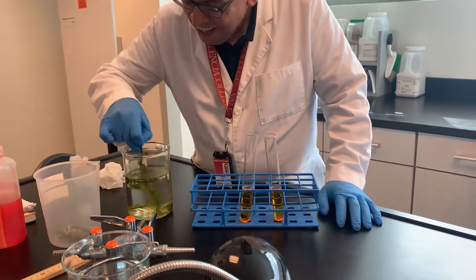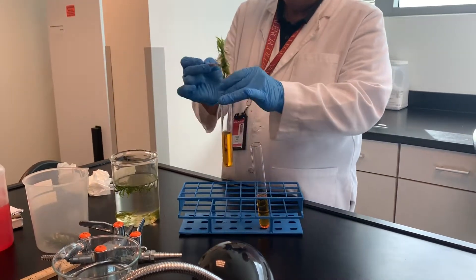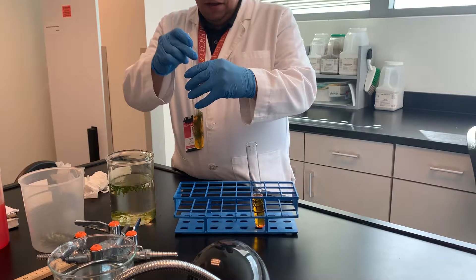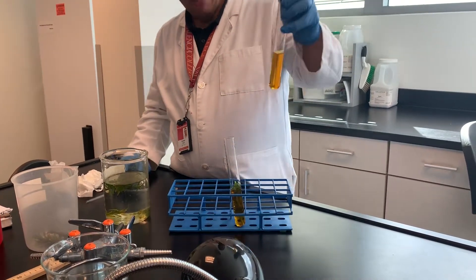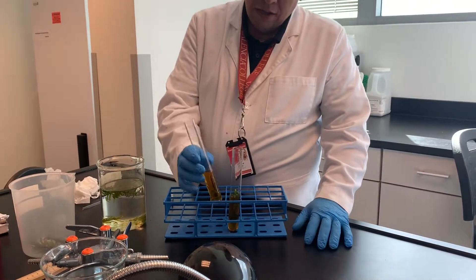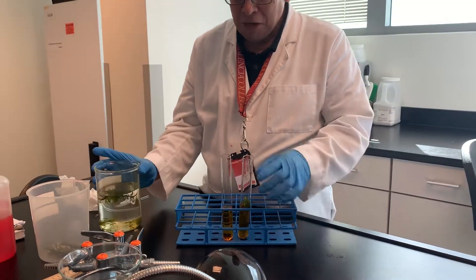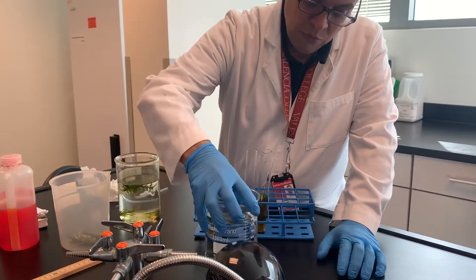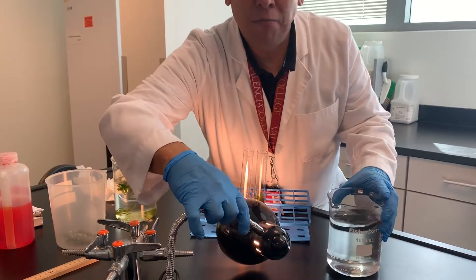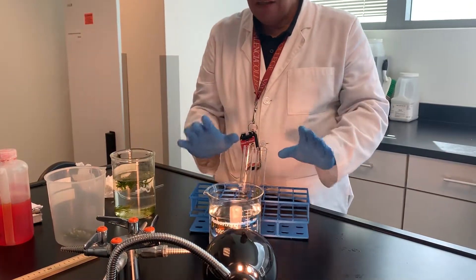The other tube will not get the plant — so what's that one behaving as? The control. Does the plant drown? No, that's where they live — aquatic plants are designed for that. I put this beaker in the middle full of water because it's a heat sink. You don't want to heat up the plant; this absorbs the heat so what you're sending to the plant is the light, not the heat.